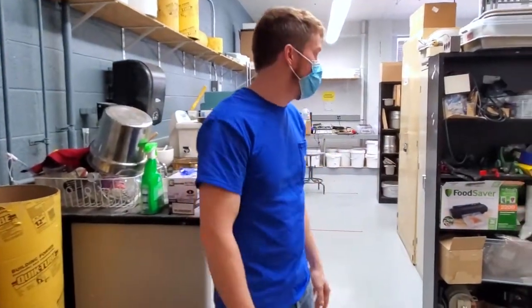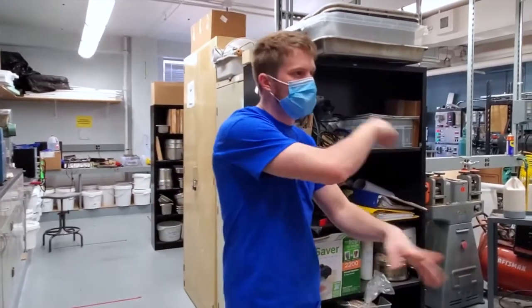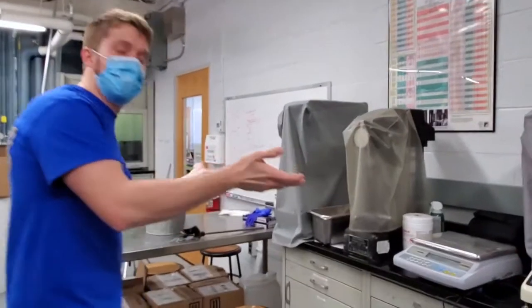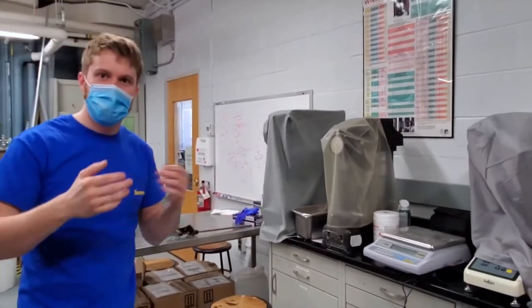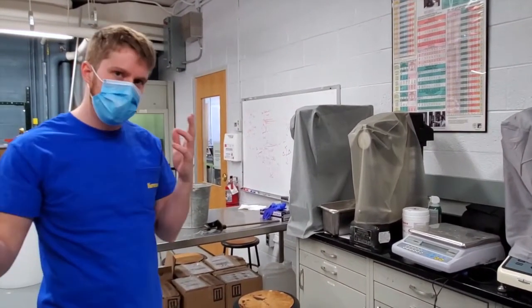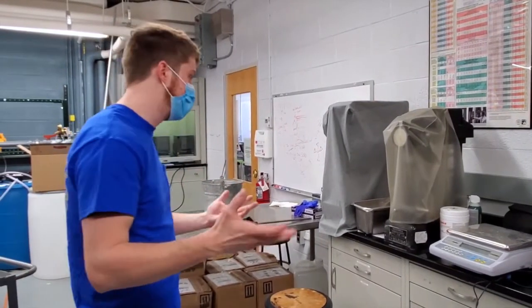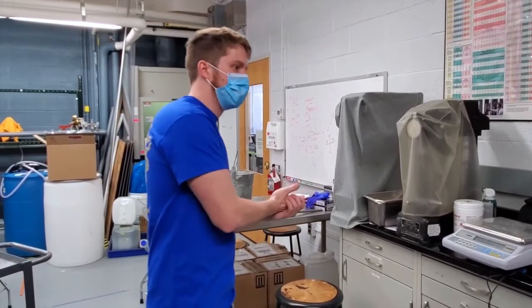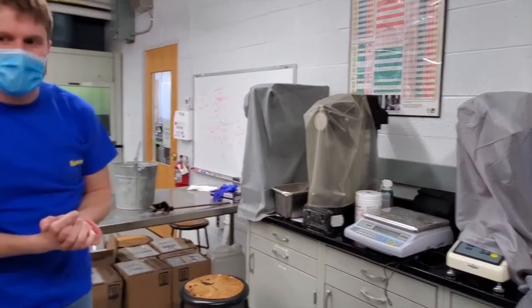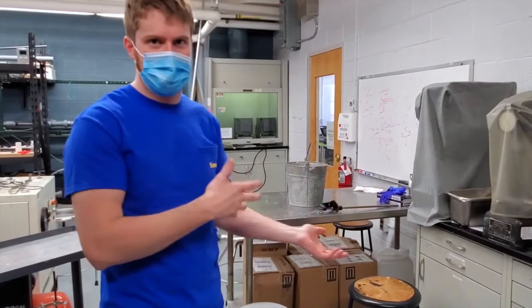Hi, this is our processing and mechanical lab. We have a number of different things here. I'll start and then just take you on. One thing here that we have is something called a hardness testing machine. This basically measures how much force it takes to displace a certain amount of material, and that tells you how hard the material is, which is a very important property to understand when you're dealing with different things. There's also a couple different types. This is Vickers, which is the most common, and then we also have Rockwell hardness testers. There are a number of ways to test hardness. Each of them has advantages for certain materials that you're working with.